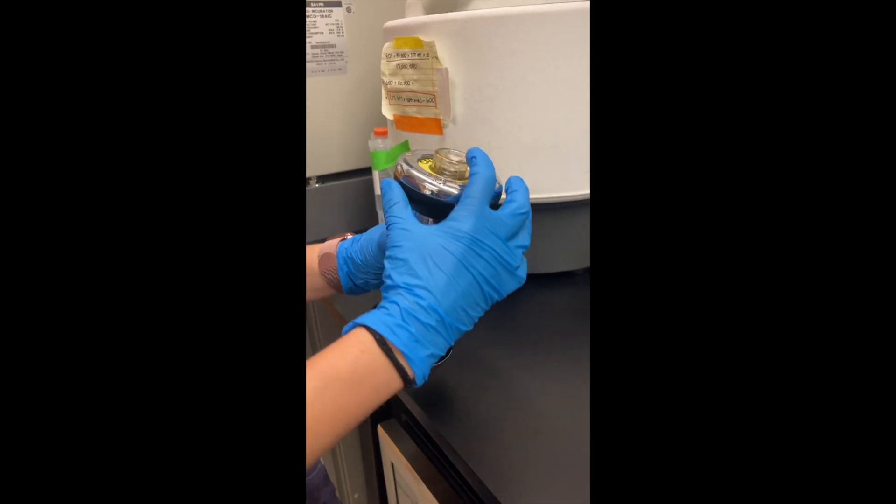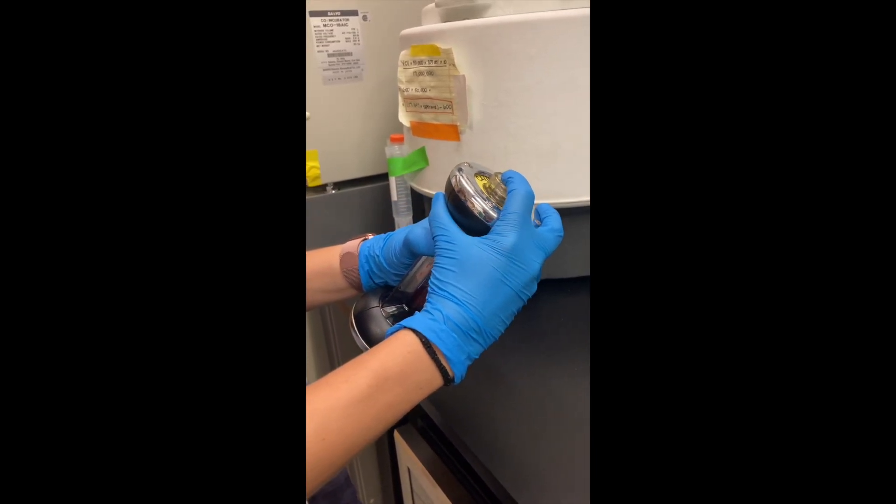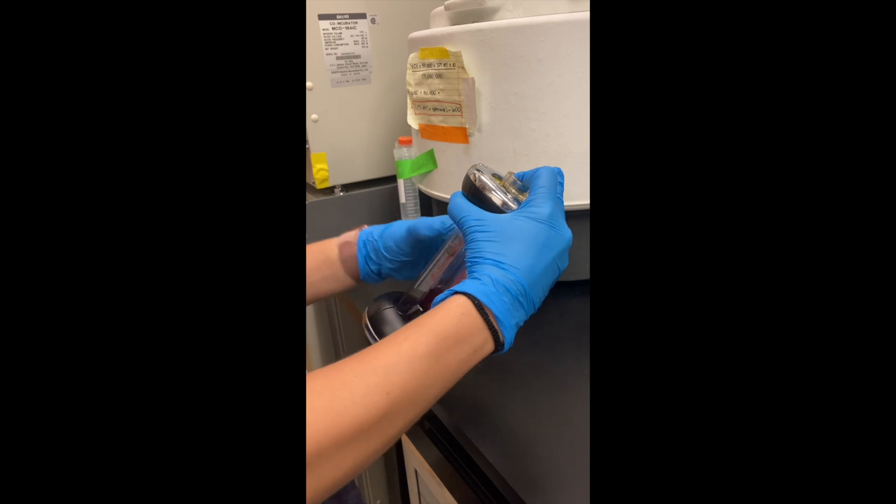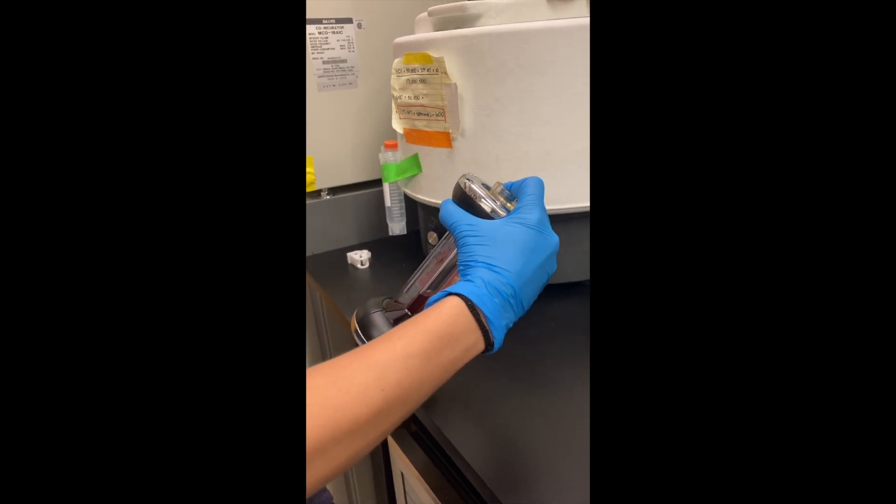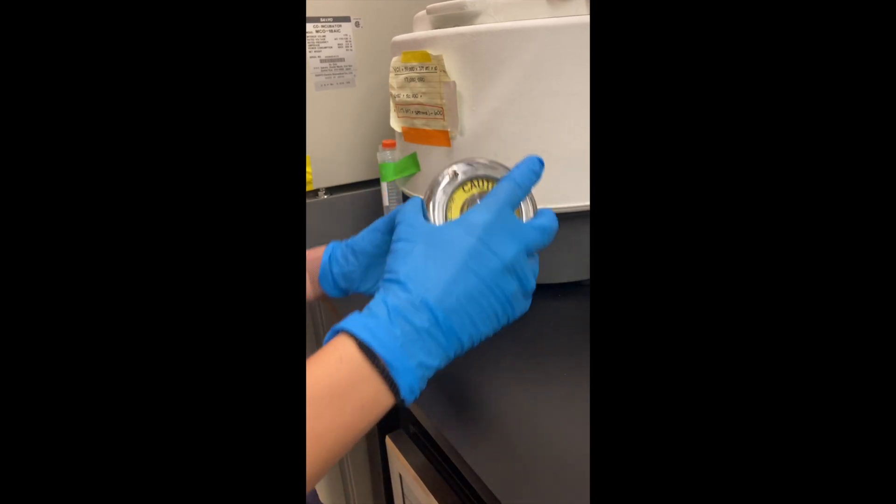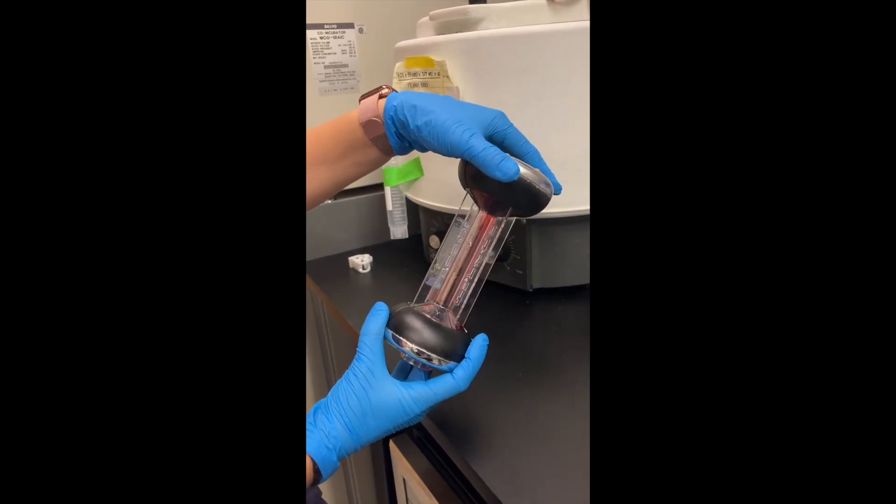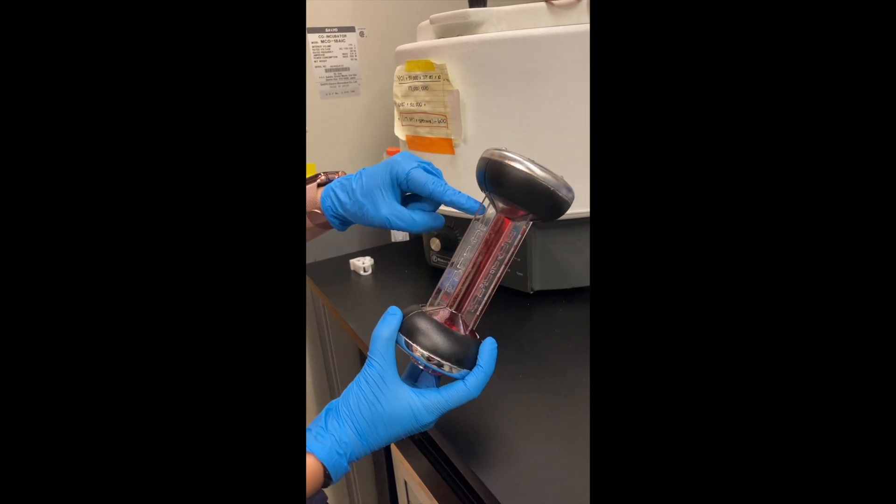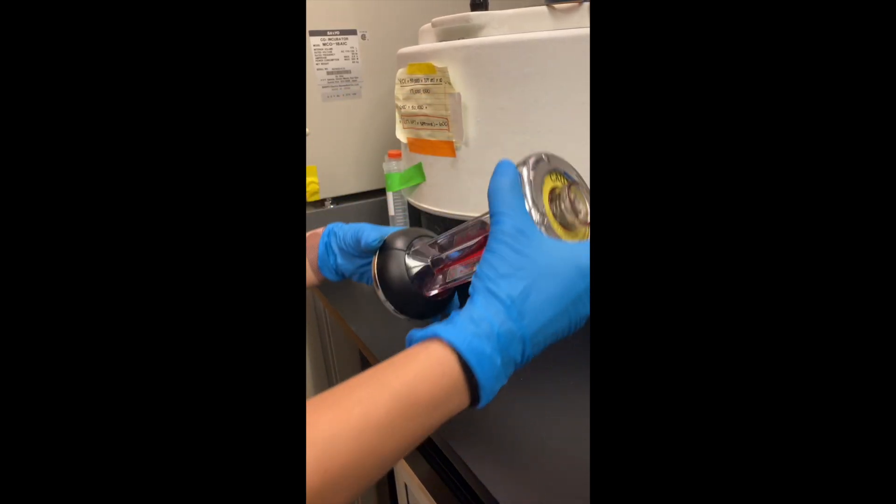So we just pump this, hold for a few seconds in an angle of 45 degrees, release, and then we flip. Wait until it goes all the way up, and then flip it back.